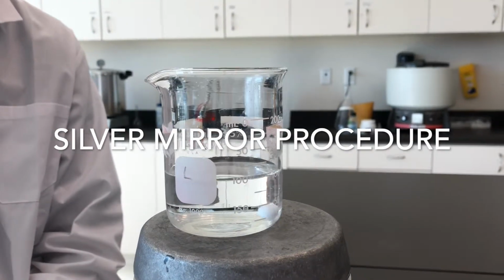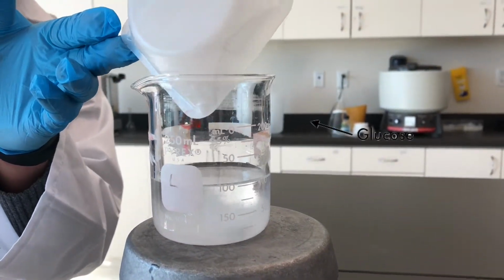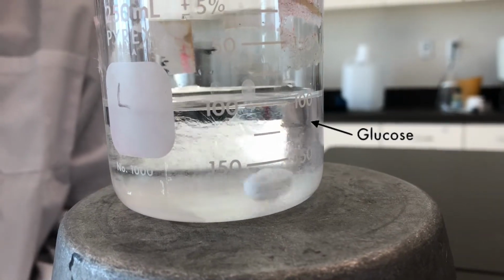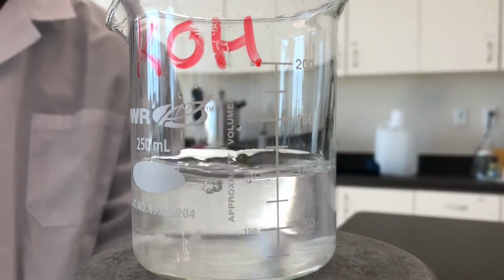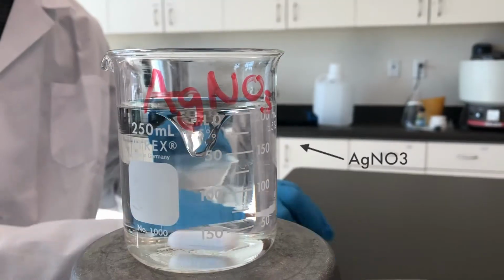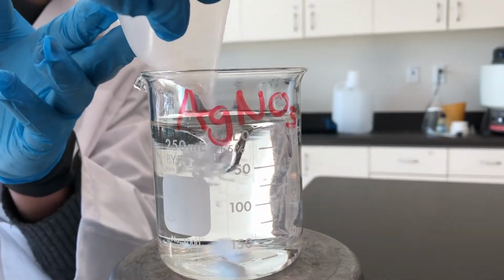First, the solutions are made. A 0.2 molar 100 milliliter solution of glucose is made. A 0.8 molar 100 milliliter solution of potassium hydroxide is also made. Finally, a 0.1 molar 200 milliliter solution of silver nitrate is made.